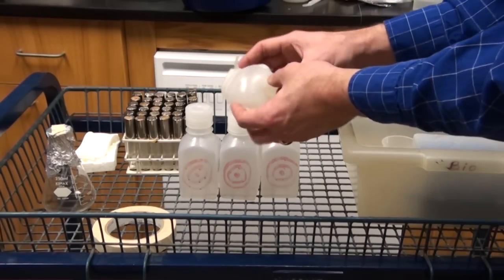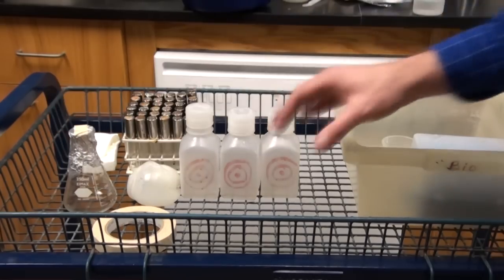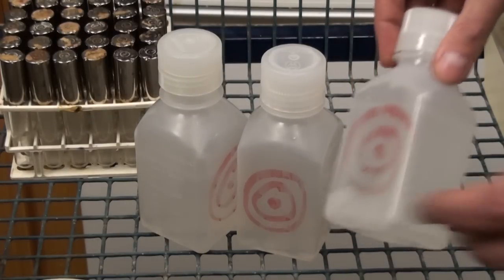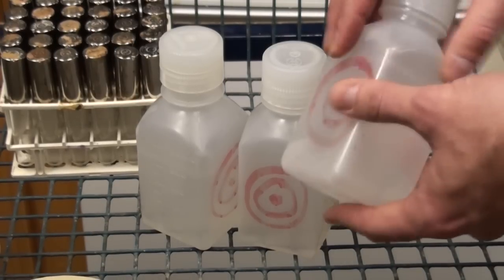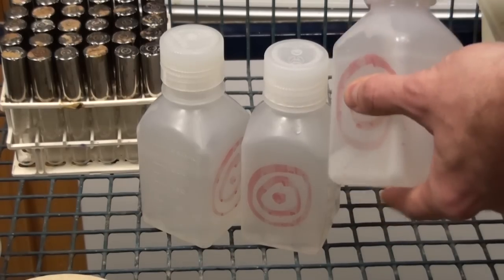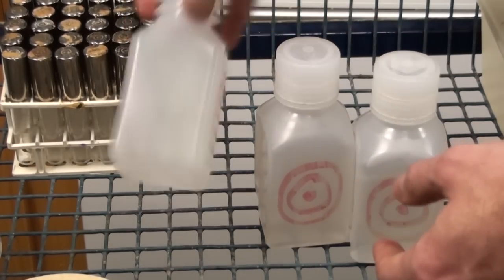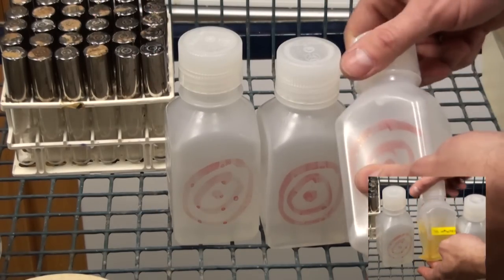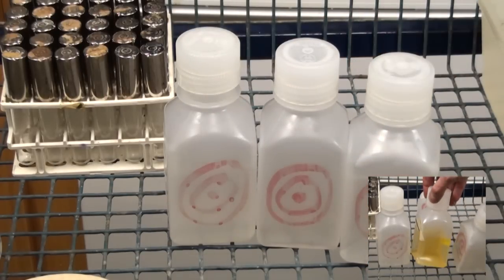Here is the bottle made from polyethylene — you can see it's a melted mess. As the capped bottles cool, air pressure decreases and a vacuum is created; you can see it folding in a little bit. In many cases these become very difficult to open. The vacuum with the cap when completely cool means you actually can't get to the material you just autoclaved.